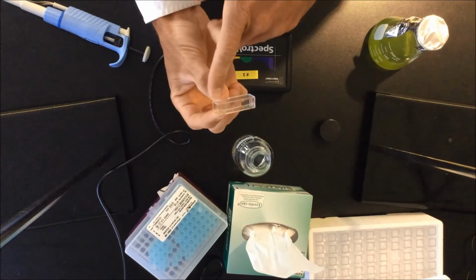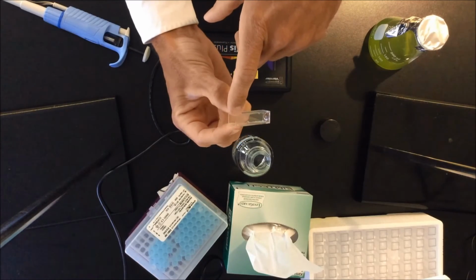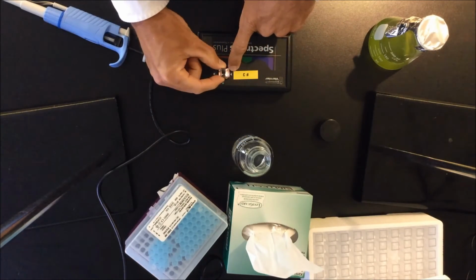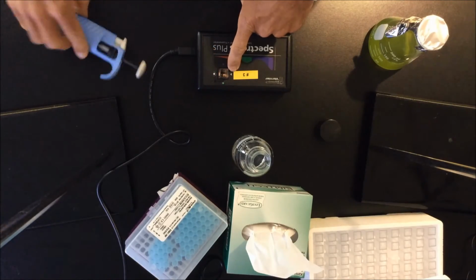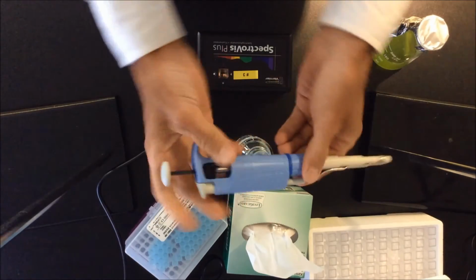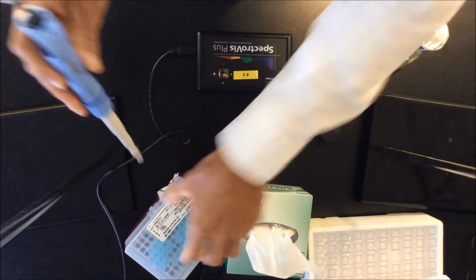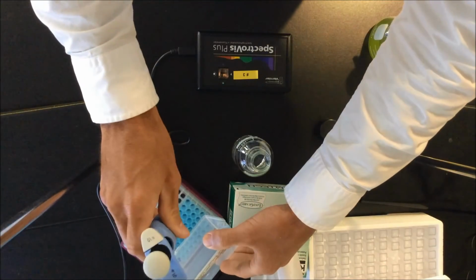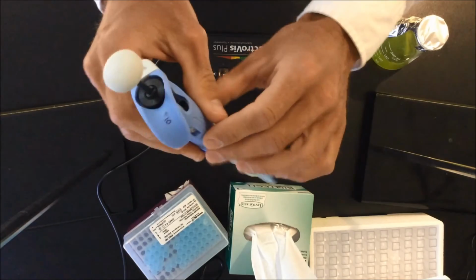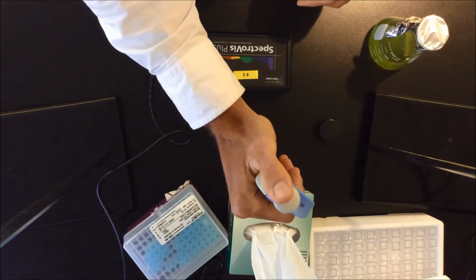Now, on the side of the cuvette, there's a tiny arrow. You probably don't see it, but it's a tiny arrow in the plastic. This arrow needs to go with the arrow that is right here, like that. Cool? Then you have your micropipette, which is set at 1 ml. You're going to open this, punch in, and close. This is all sterile stuff. You're going to go in and take 1 ml.